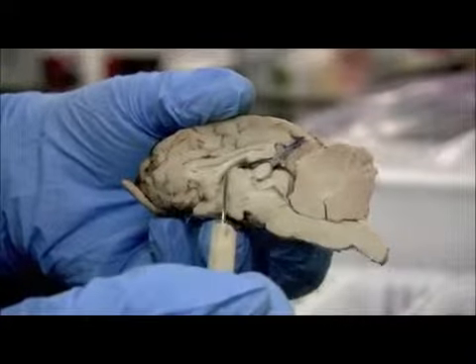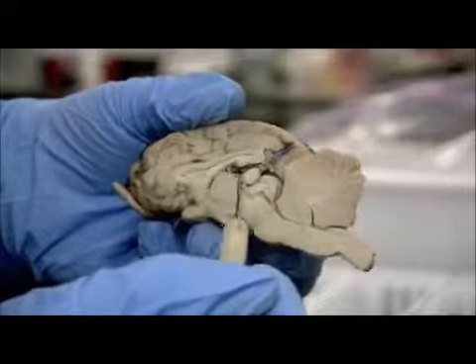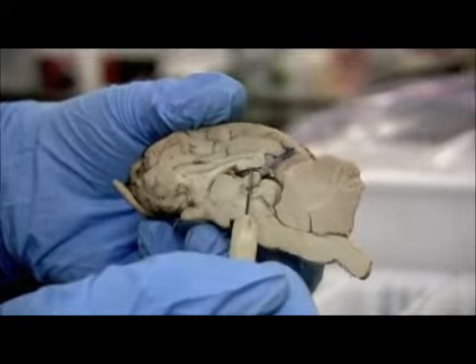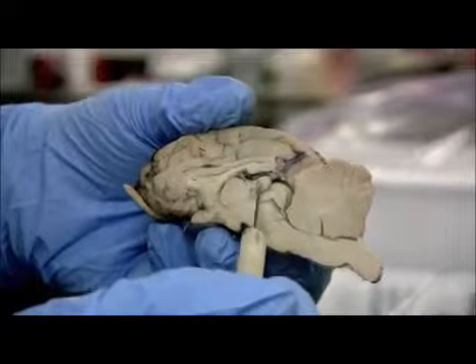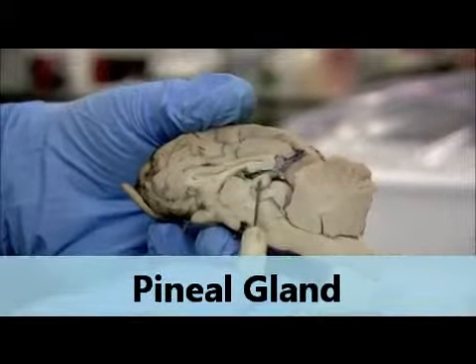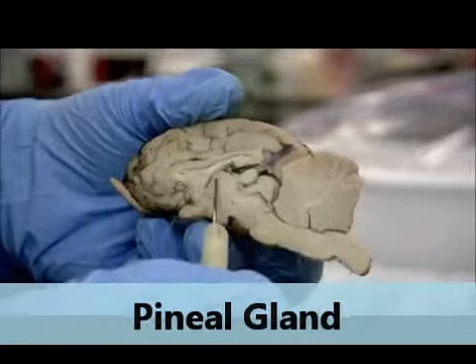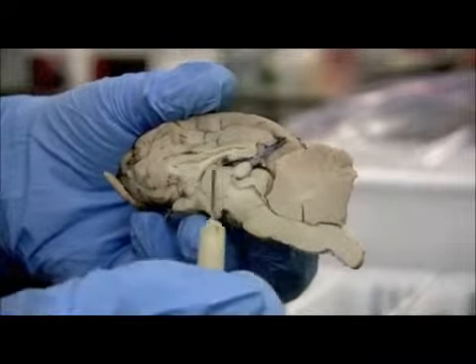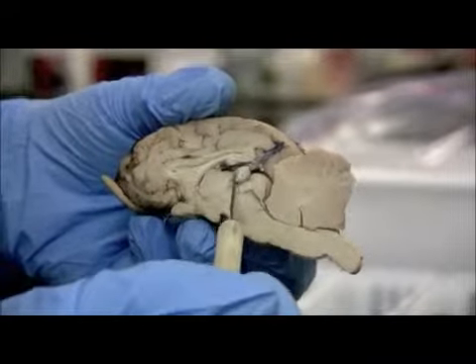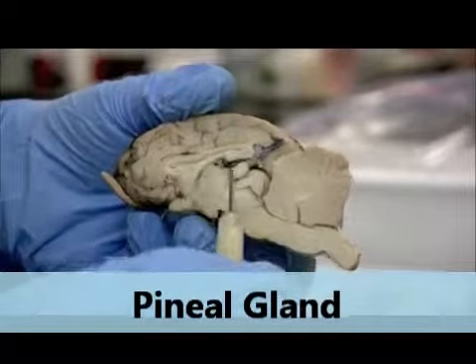Okay, the epithalamus is upon the thalamus, and it's going to go over the top of the thalamus, just a very thin line that's going to end here in this other round structure. That's the pineal gland that produces melatonin that helps regulate your circadian rhythms. So it's pretty large. You can see here in the sheep brain, the big round circle is the thalamus. The smaller round circle behind it is the pineal gland. Epithalamus connects it.